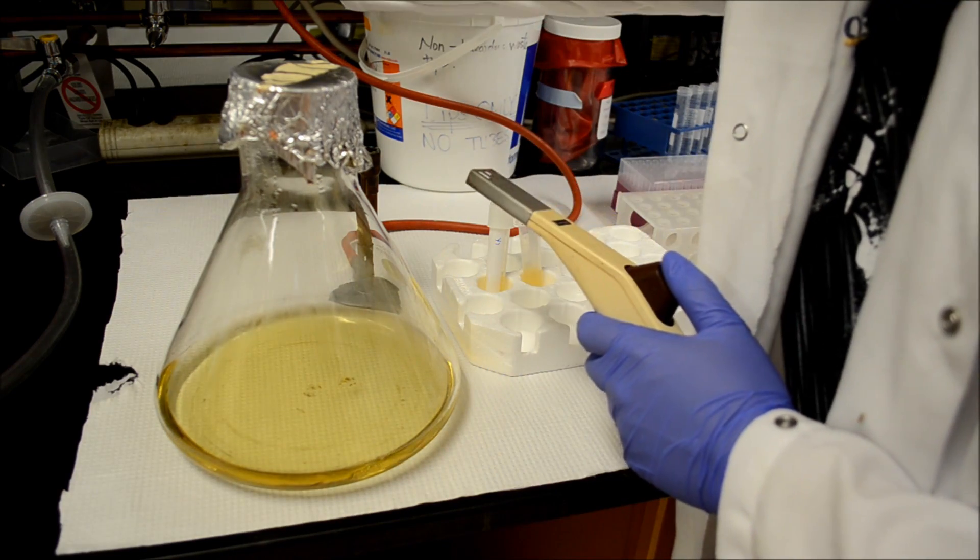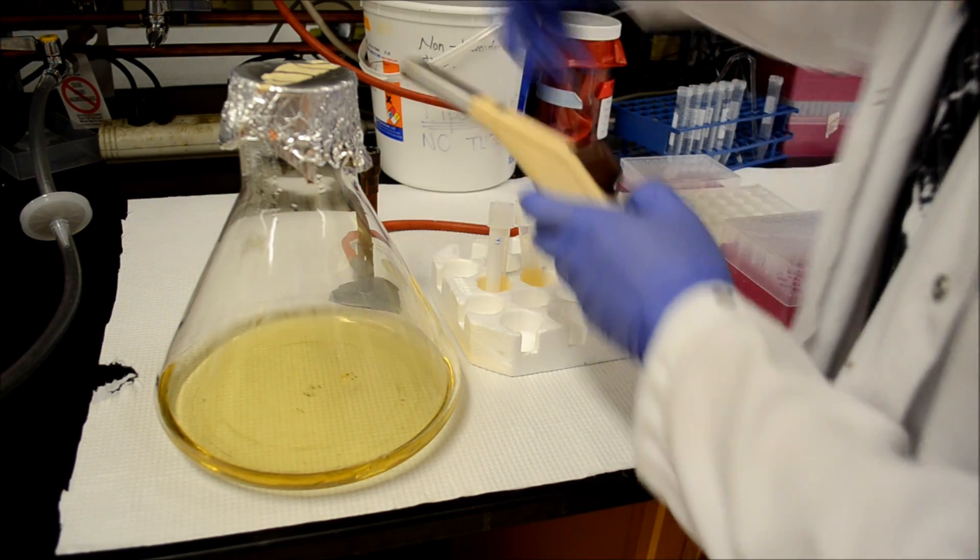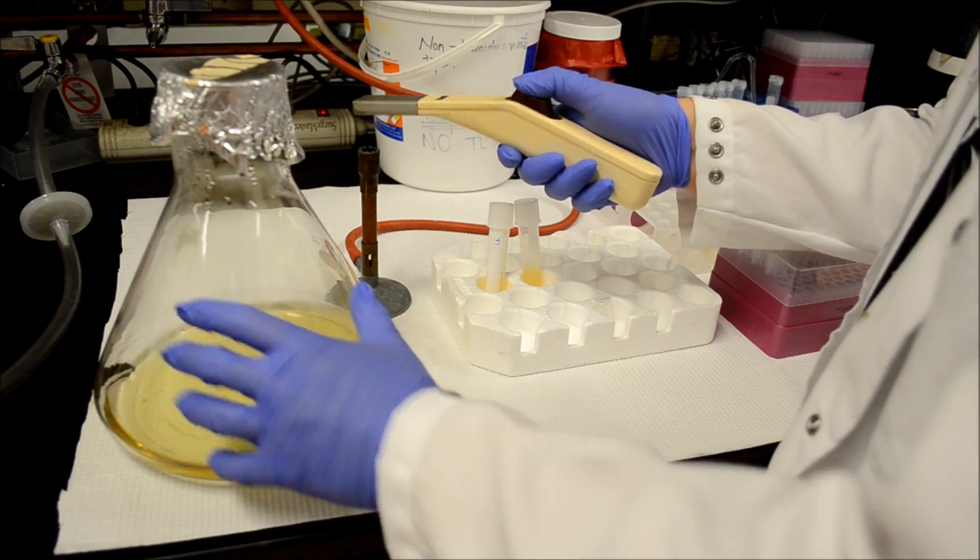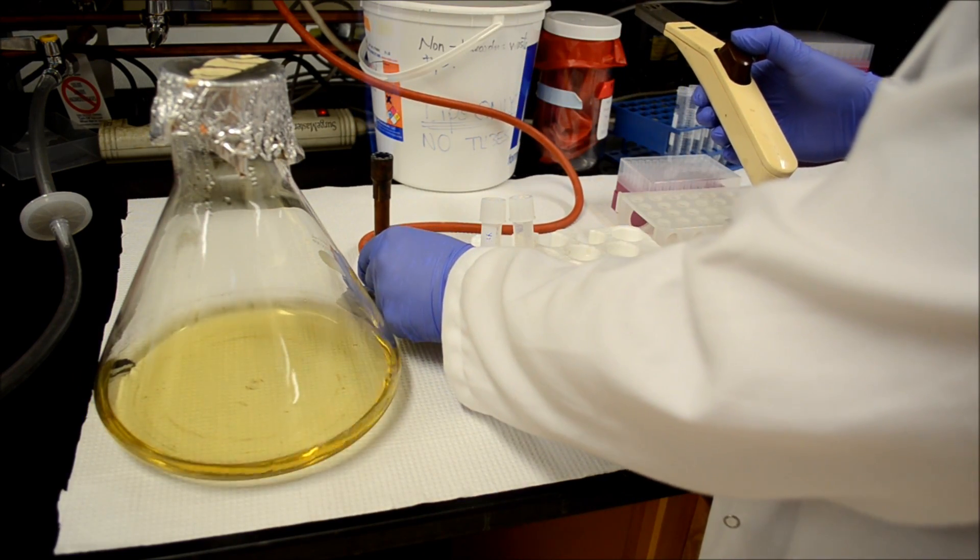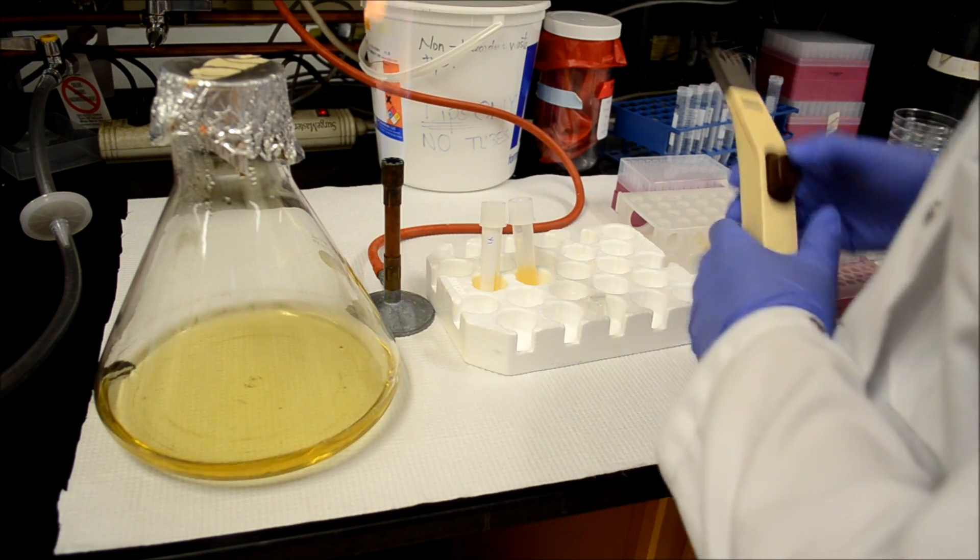For all aseptic techniques involving bacteria, you should light a Bunsen burner to reduce the amount of contamination. The flames will drive away any airborne bacteria that are present.